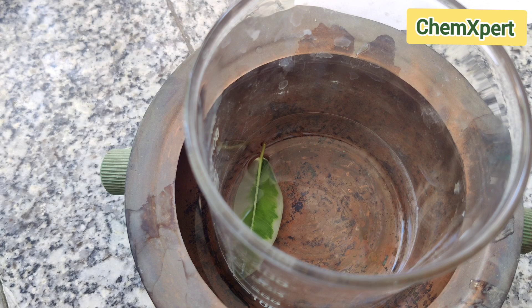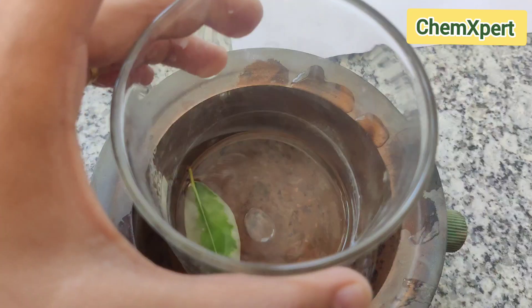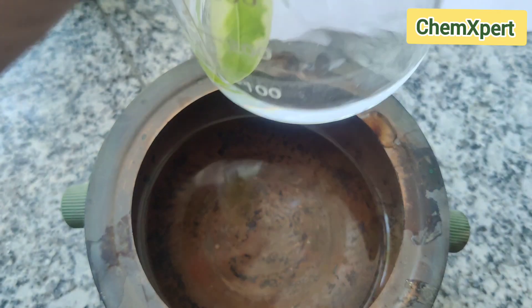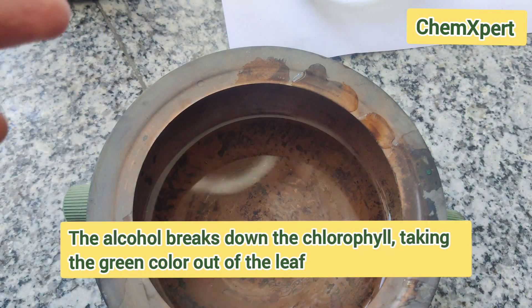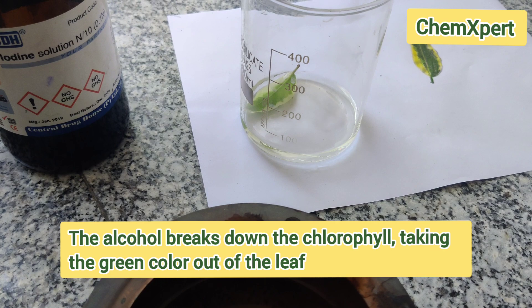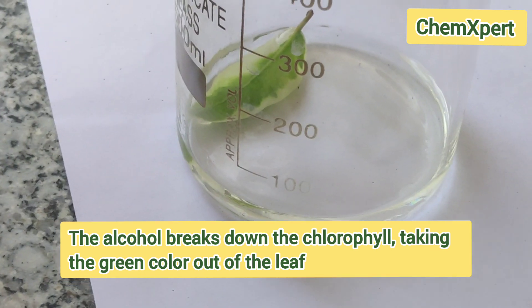Another reasoning question: why are we boiling this leaf in alcohol? The alcohol will break down the chlorophyll, taking the green color out of the leaf.